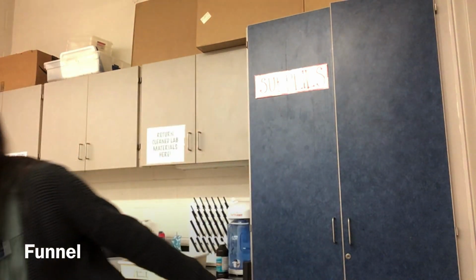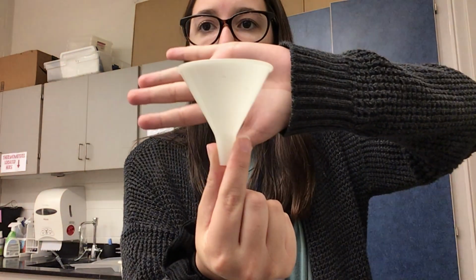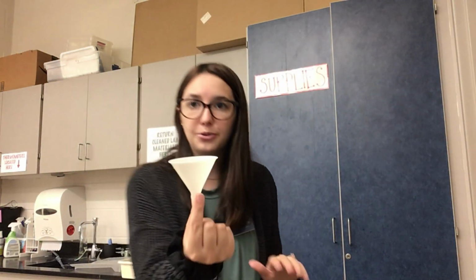So, number one instrument I want to show you is a funnel. Funnels are used outside of the lab, really. It funnels out waste of sorts. So when I have water going through here and I want to drain it out, I can drain out a sample water with this by putting in filter paper, like what you use for coffee.